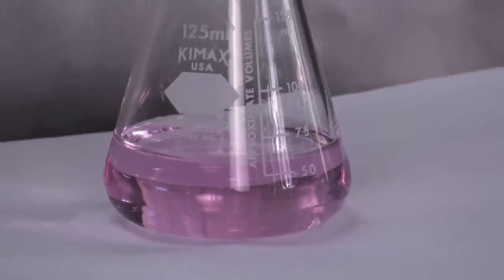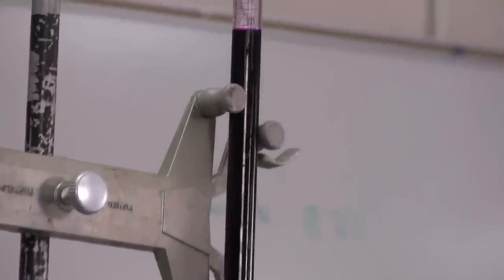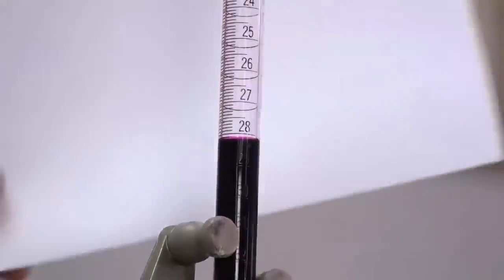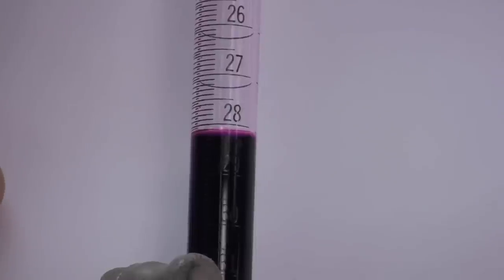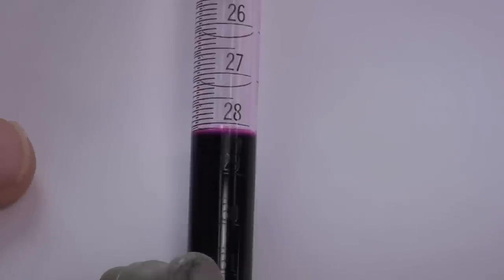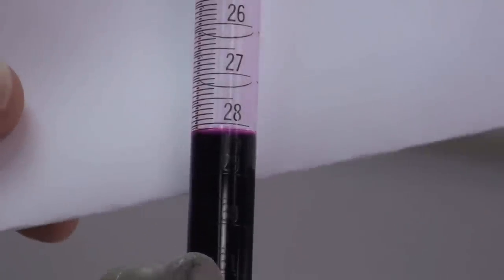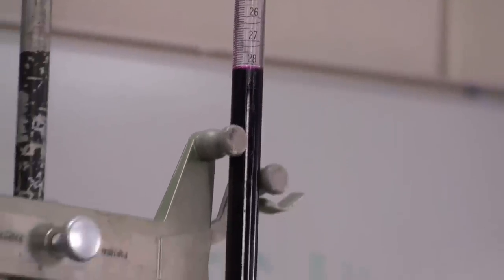So let's now measure what the final volume is in our burette. We do that the same way. It helps oftentimes to read these if you put a background behind there. It looks like the volume is about 28. It's just a hair below 28, not quite down to the next line. It's kind of tough to see. I'm going to call that about 28.05 milliliters. And I'll record that then as our final volume.